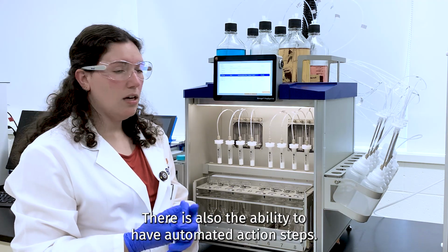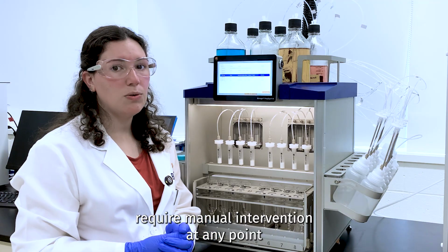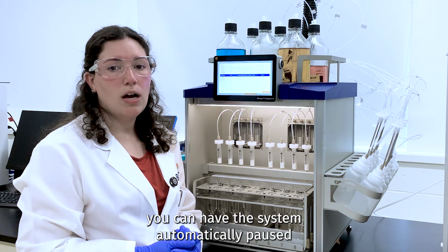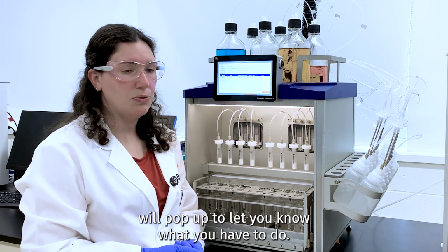There's also the ability to have automated action steps. So if you do require manual intervention at any point during your extraction process, you can have the system automatically pause and that action step will pop up to let you know what you have to do.